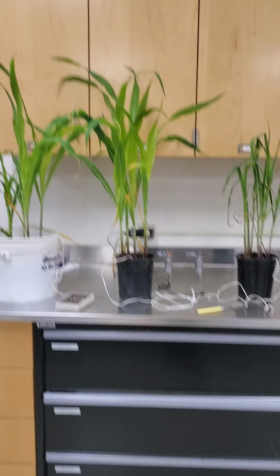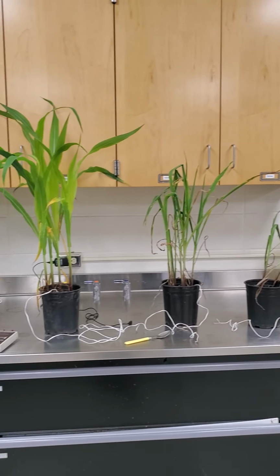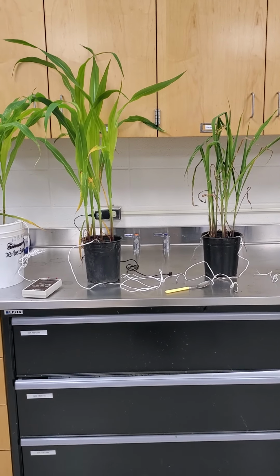and use that information to figure out how much water is actually available to plants. So one last look. These are 4 different treatments. This data will be available to you on Canvas in an Excel file.